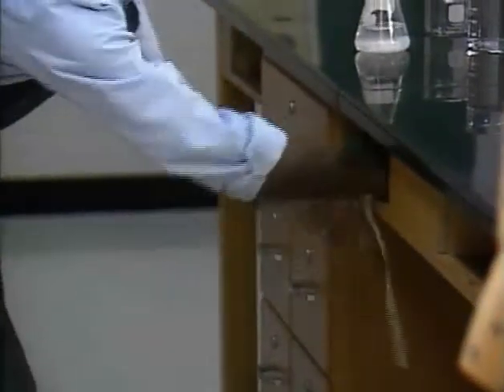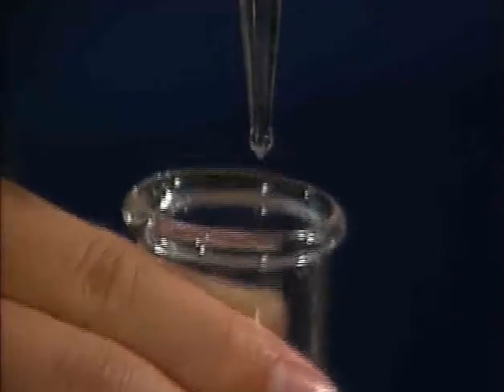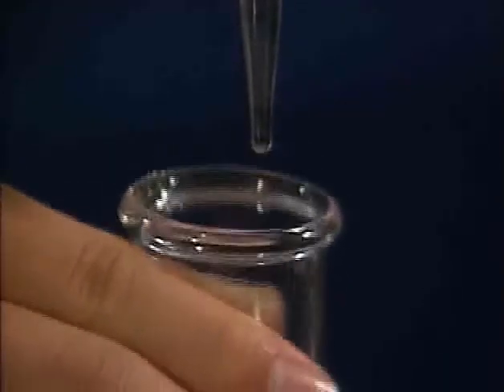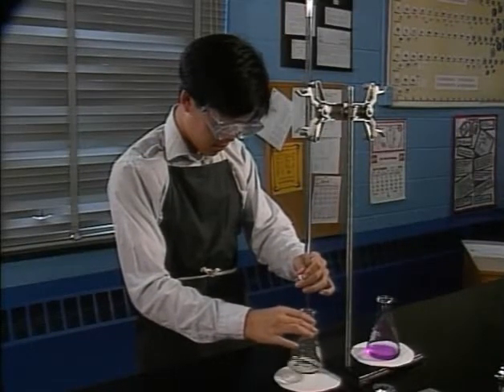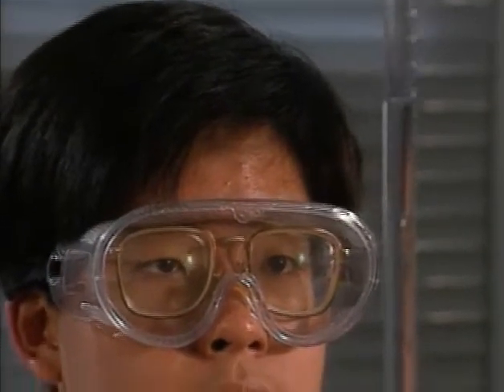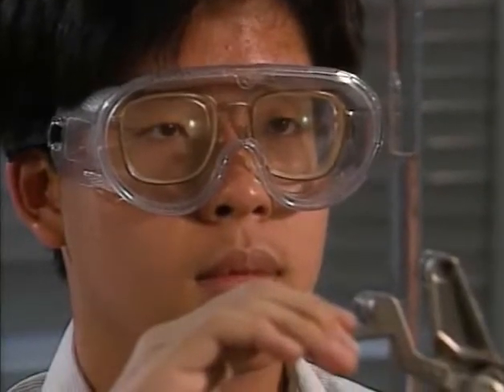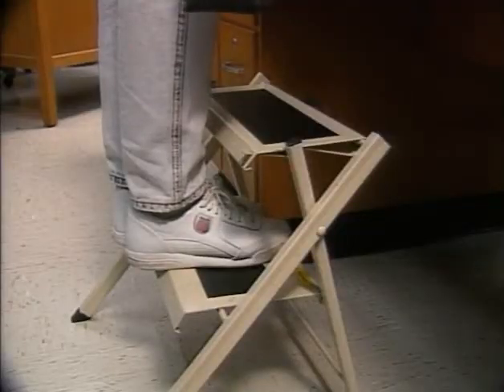Personal belongings in the middle of aisles can trip someone. Even a job as simple as reading a burette can lead to an accident — for greatest accuracy your eyes should be on the same level as the number you're reading. If you can't read a burette accurately, lower it down to eye level. If you can't do that, stand on a step stool.